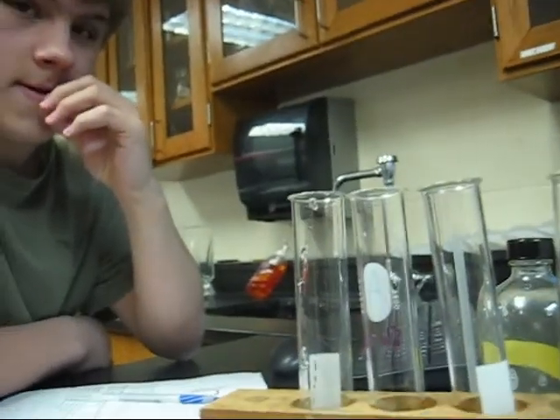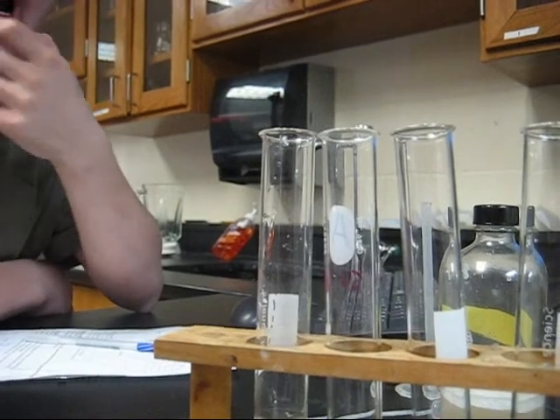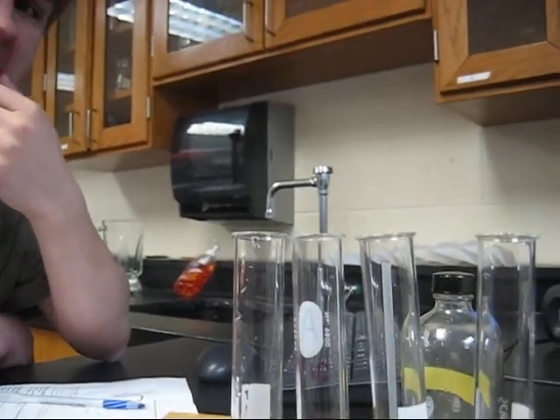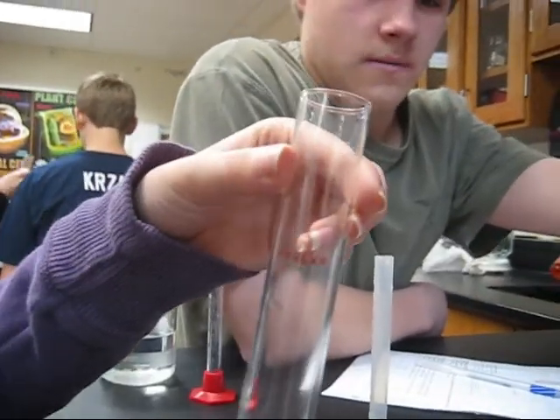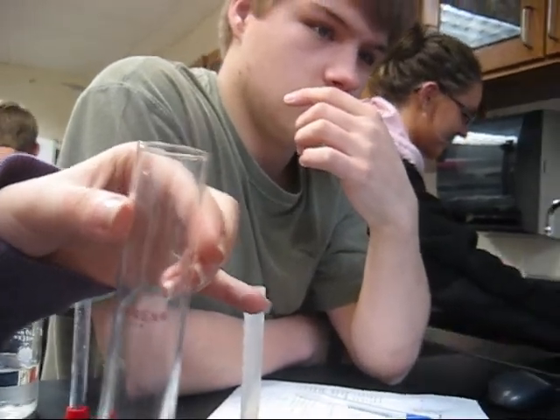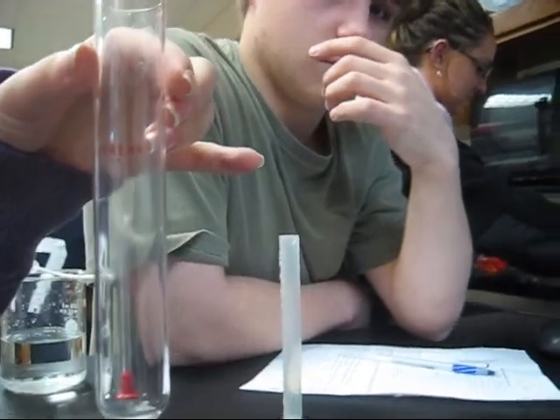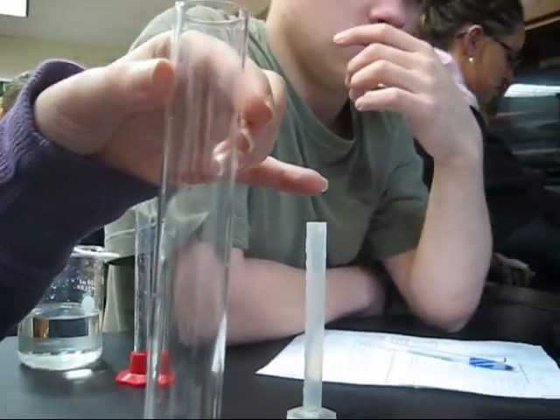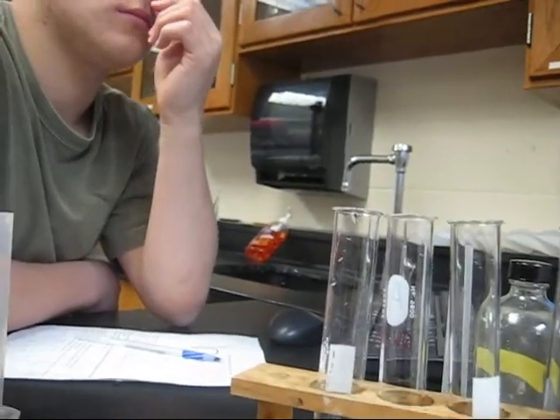In this tube, we have now added 5 milliliters of hydrogen peroxide and 5 milliliters of water. We will take 5 milliliters of this combination and add it into this tube. We will then take 5 milliliters of the liver, suspended in water, and test the reaction. Every 20 seconds, we will see how much of the air product will add in the cylinder. This test has a 0.5 concentration of liver and a 0.75 concentration of hydrogen peroxide.